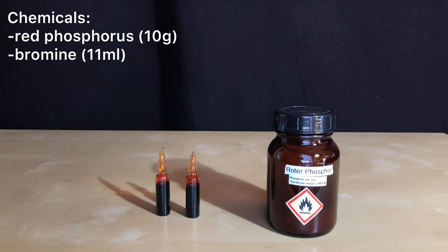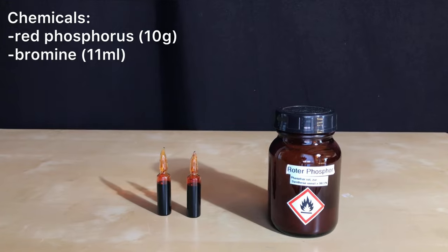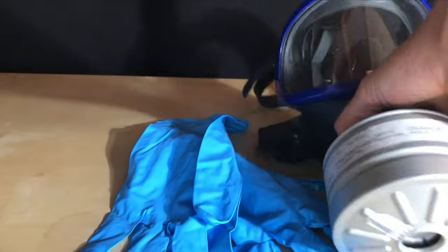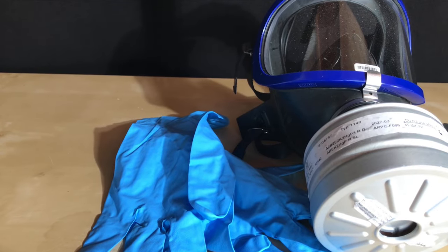This means that we soon will have to make some more of it, and by some I mean a lot. Because bromine and phosphorus tribromide are toxic, we are going to put on gloves and a gas mask for our own safety.